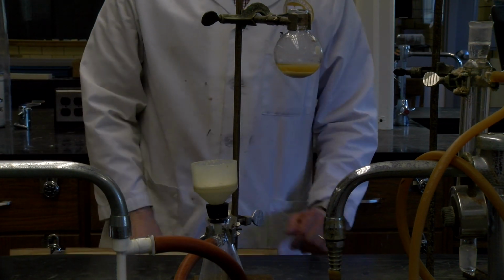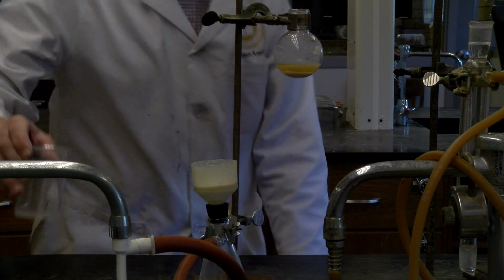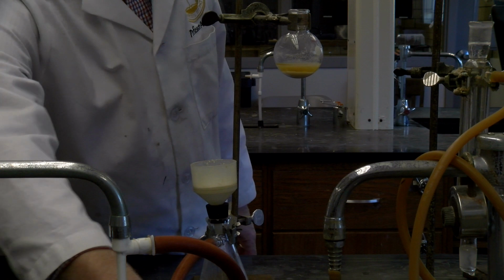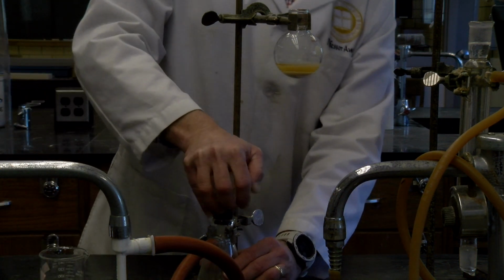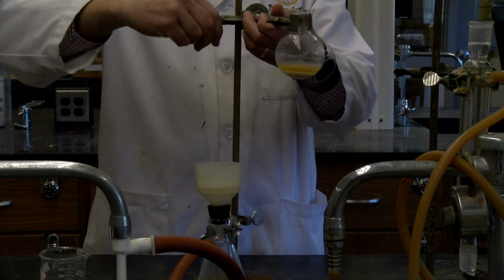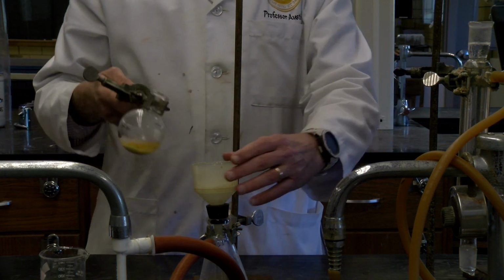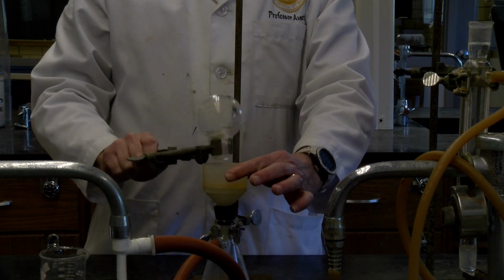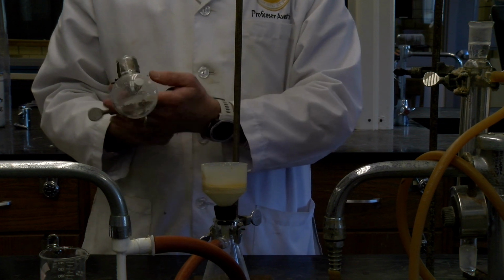Alright, so one of the things I did last time as well is to get just a little bit of water, get it, and heat this guy. Yeah, so make sure this sticks there, so that's looking good. And so now we're going to separate the crystals of fumaric acid from the solution. You start to see some of the suction that's occurring, so that's coming off.